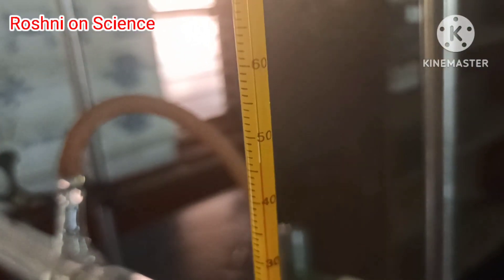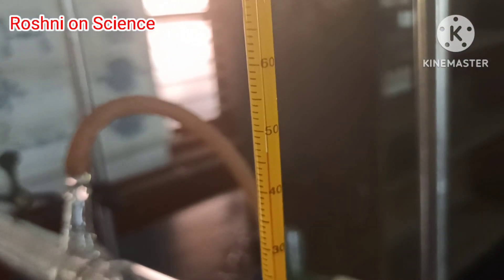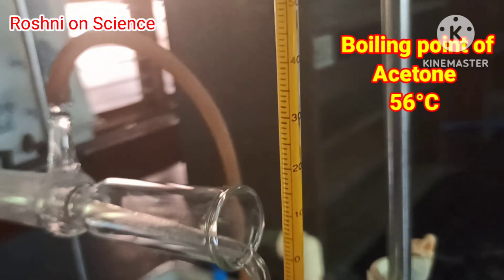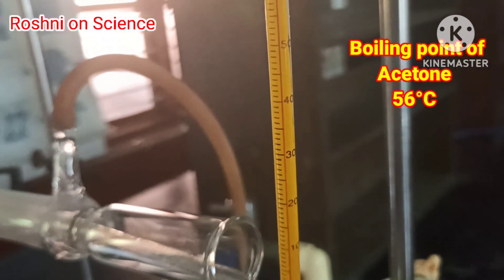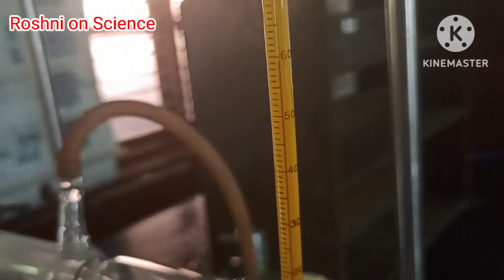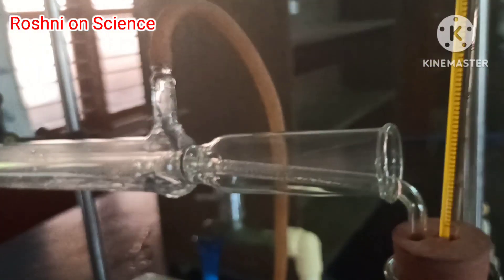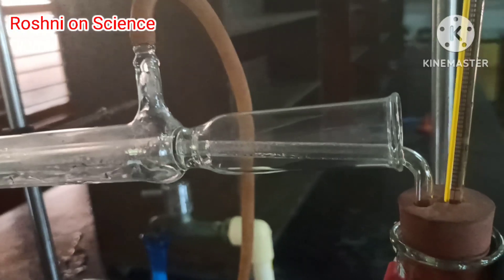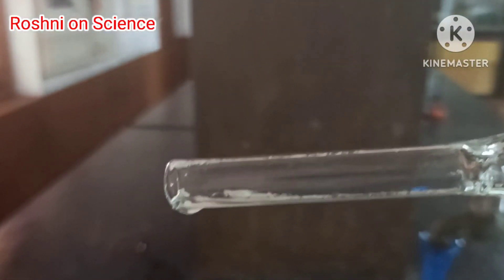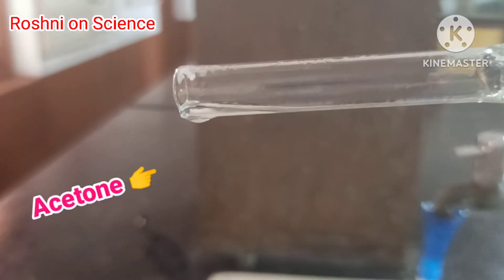When the temperature rises to 56 degrees Celsius, acetone starts to boil and gets separated from the mixture. Acetone vaporizes, then gets cooled in the Liebig condenser and is converted back into liquid acetone.